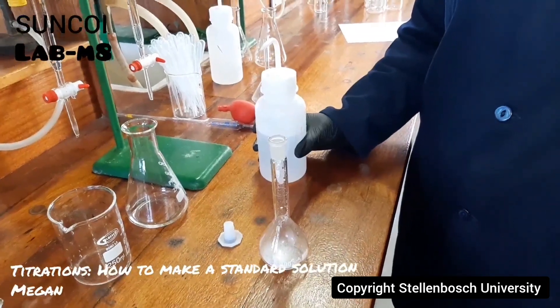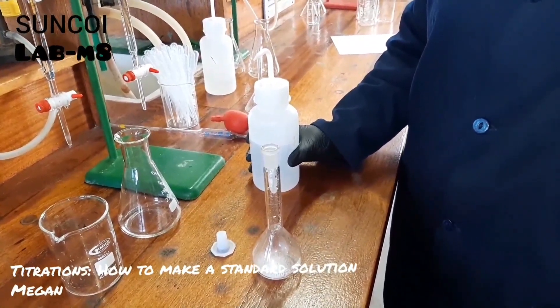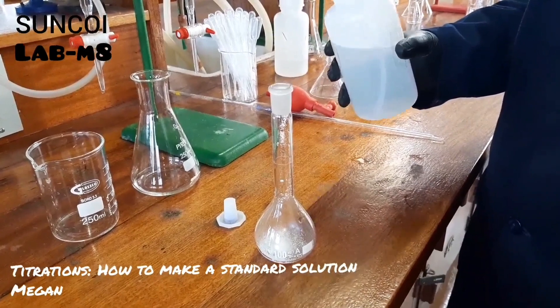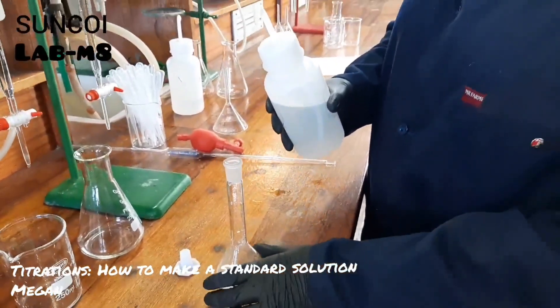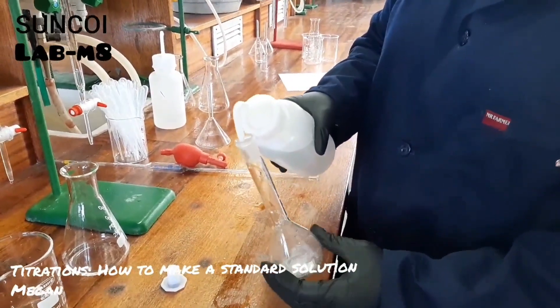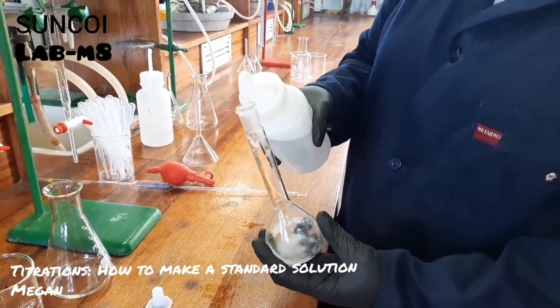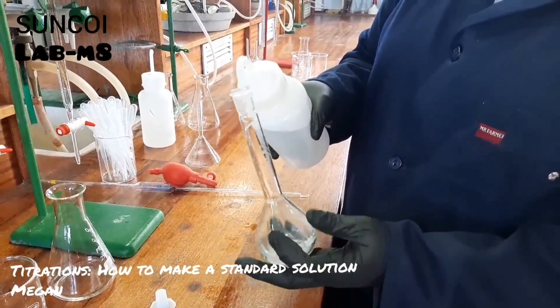Megan will show you how to prepare a standard solution. You need to calculate first how much oxalic acid you need to prepare a 0.1 molar standard solution in a 100 milliliter volumetric flask. We've already done our calculation — you must do that on your own — and now we have added the oxalic acid to our volumetric flask.